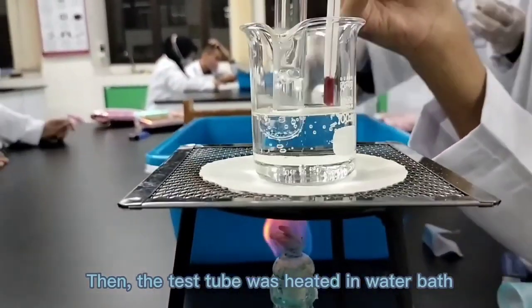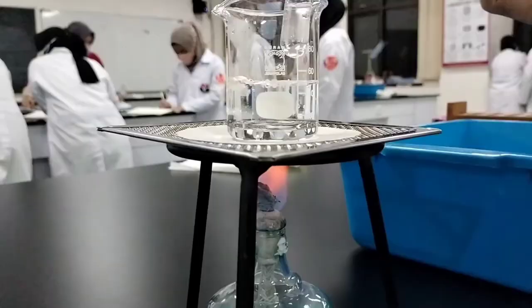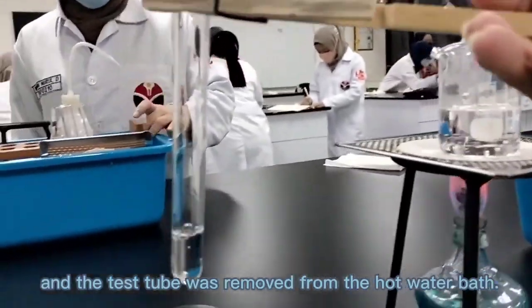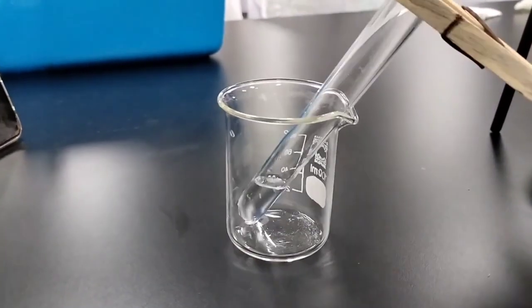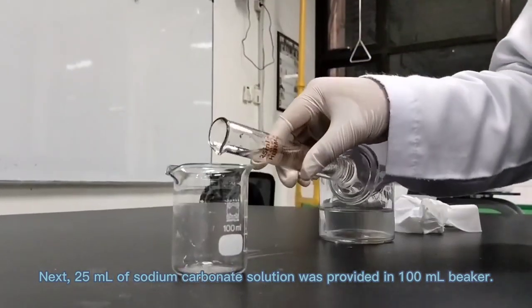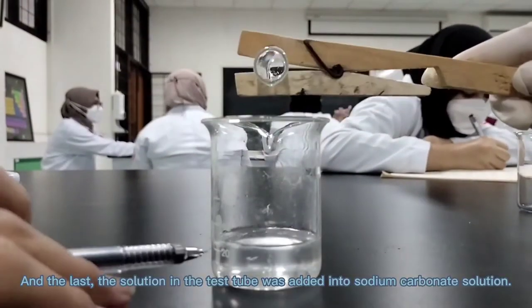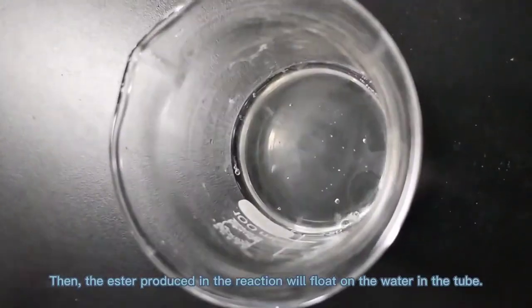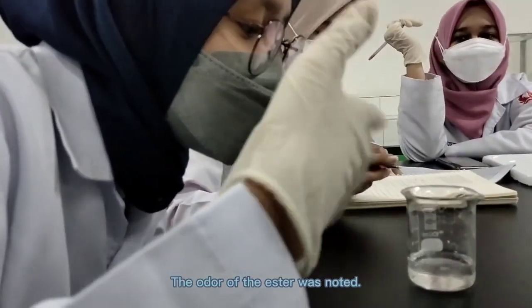Then the test tube was heated in a water bath until the water boiled. Next, the burner was turned off and the test tube was removed from the hot water bath. Then the test tube was cooled. Next, 25 ml of sodium carbonate solution was provided in a 100 ml beaker. And the last, the solution in the test tube was added into the sodium carbonate solution. Then the ester produced in the reaction will float on the water in the tube. The odor of the ester was noted.